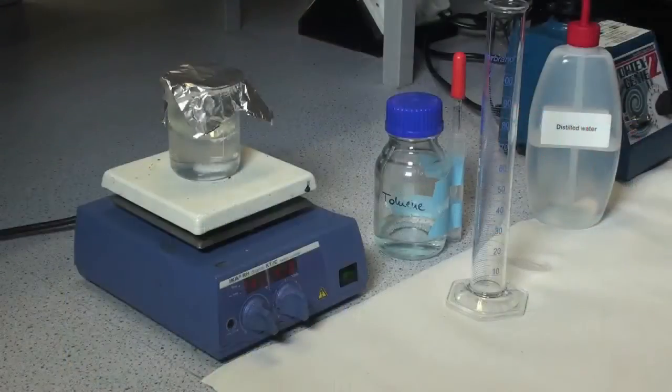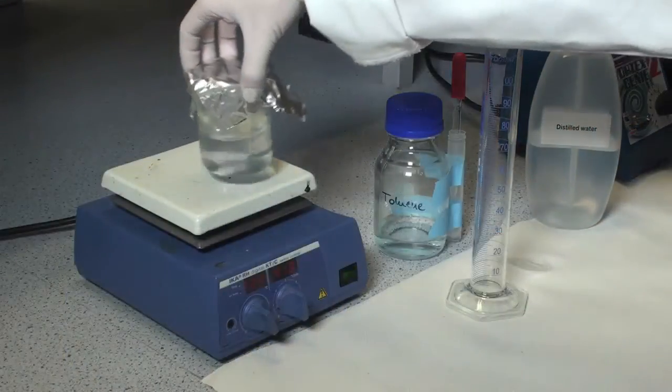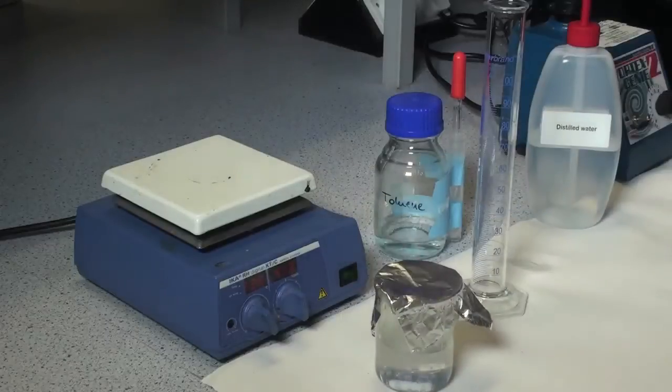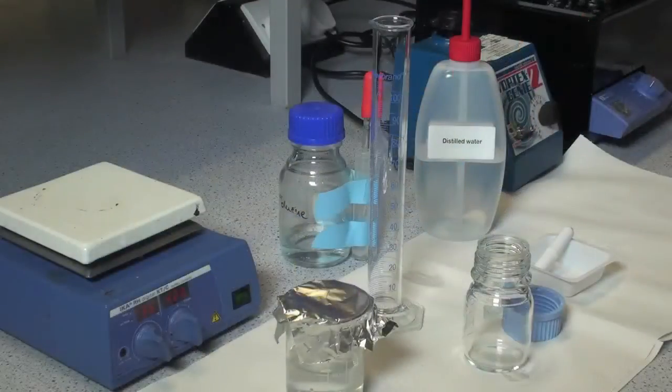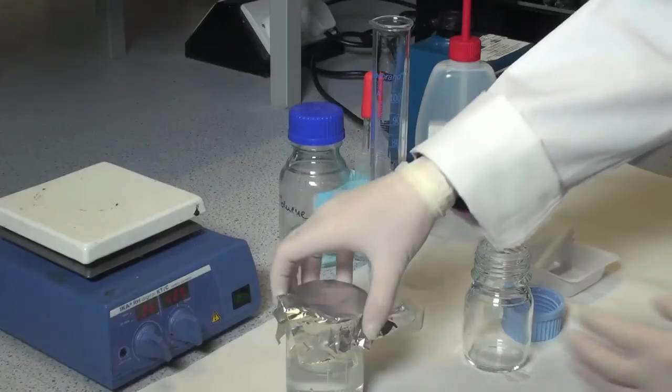Transfer the beaker to the bench top and allow it to cool to room temperature. Transfer the solution to a 100 ml measuring cylinder.